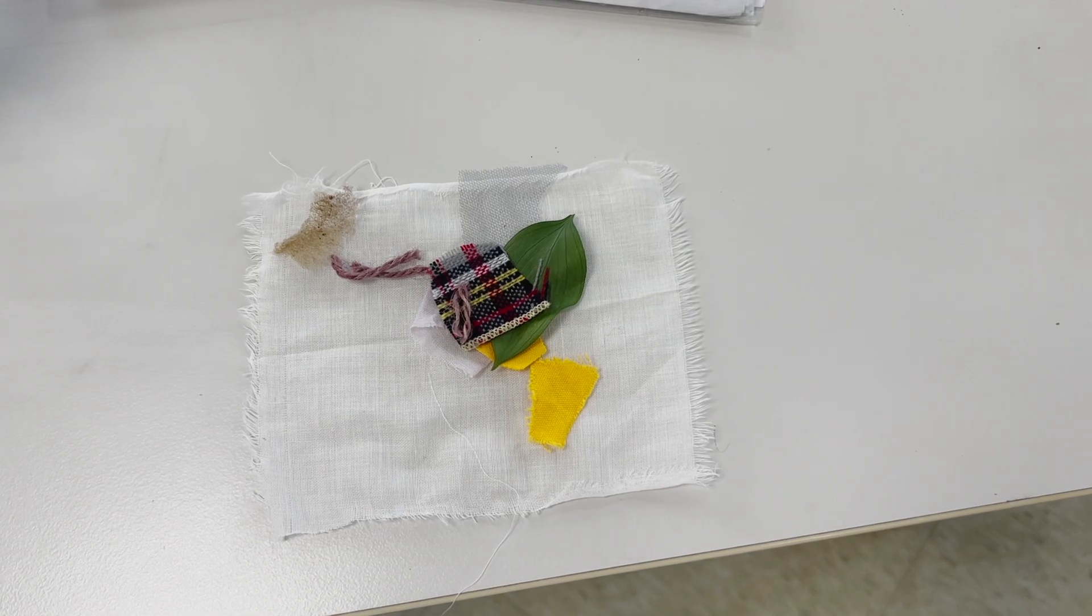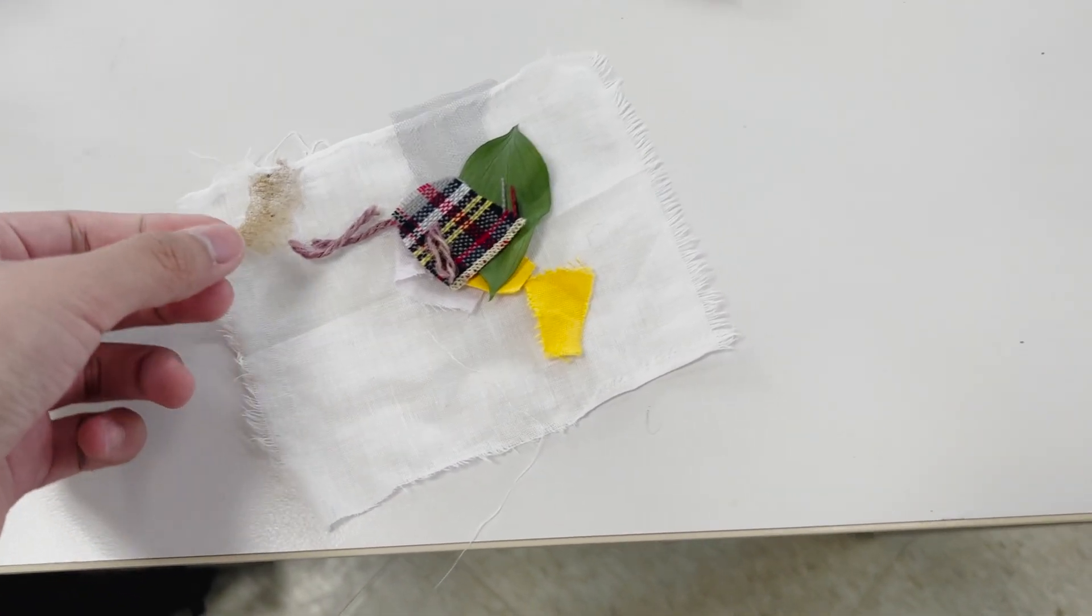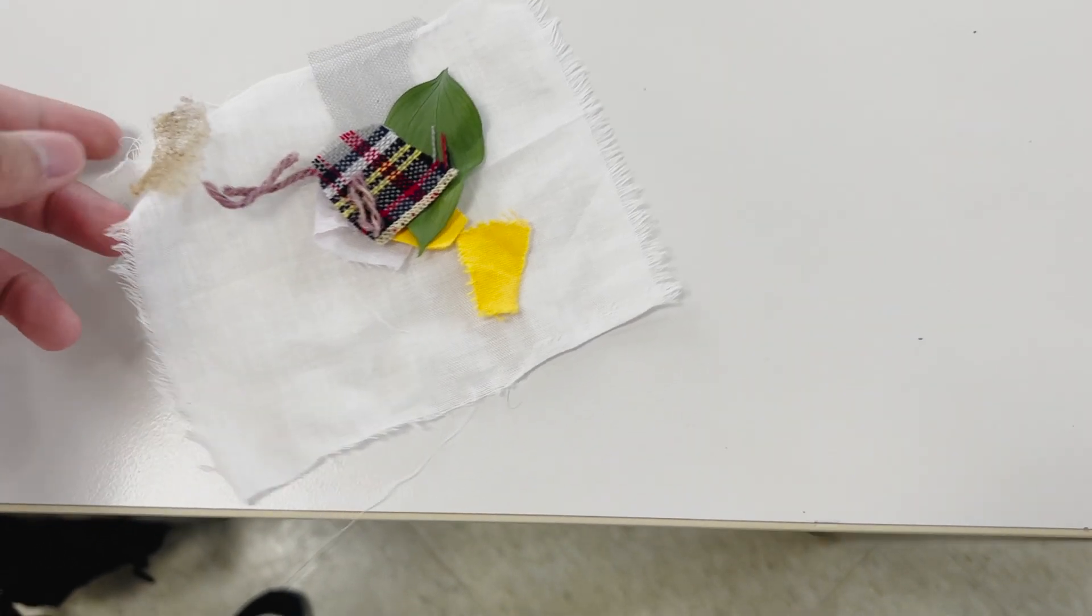To begin using photomicrography, you need a set of materials that you want to photograph. Here I have a collection of mostly fabric materials.